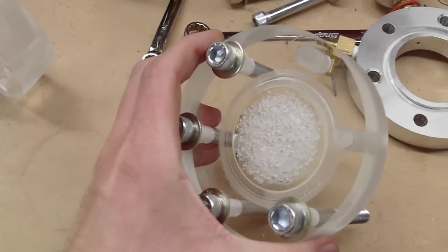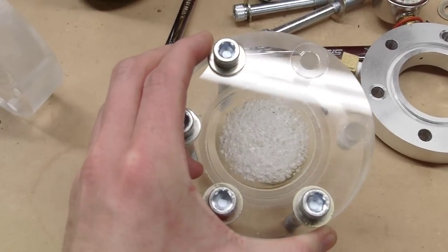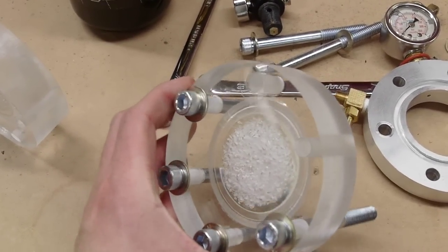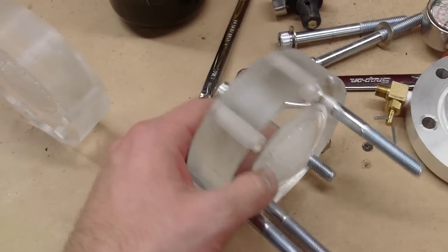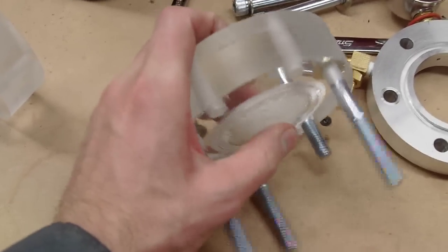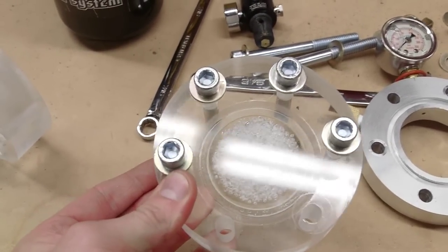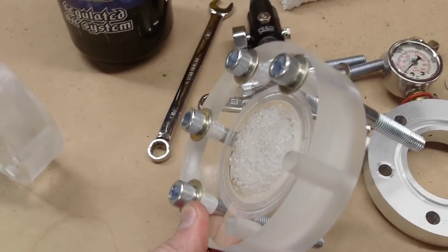So obviously what has happened is the high-pressure CO2 went inside the acrylic, and over time has been decompressing and deformed the acrylic quite strongly. I don't know if this is very reversible, and it's quite hard. It's not like this is a sponge or anything. This feels just like normal acrylic with bubbles in it, basically. So, looks like I'm either going to have to retire this chamber or build another set of windows for it.